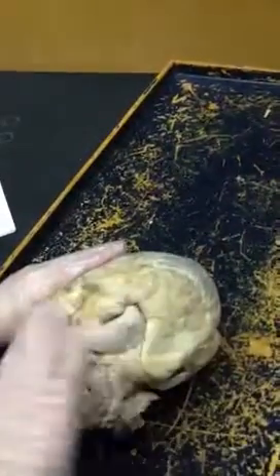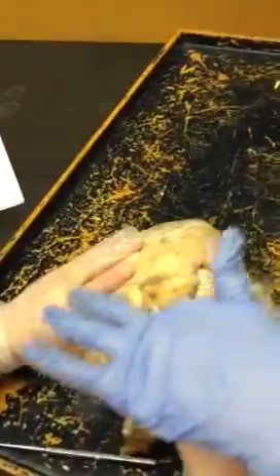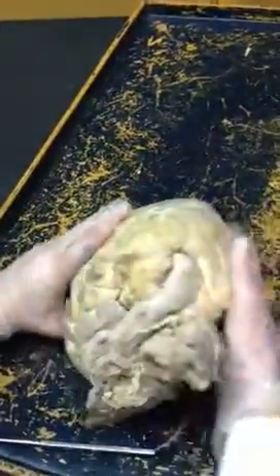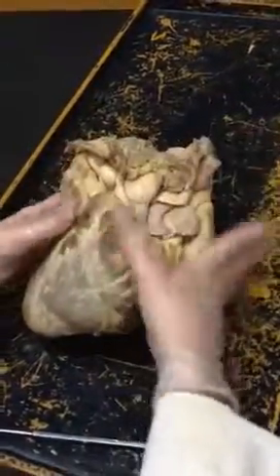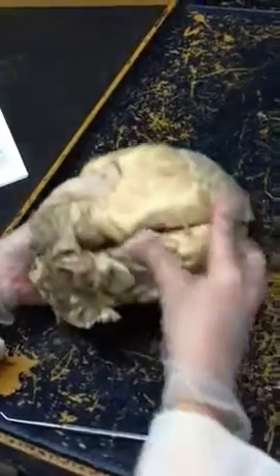So we have the pretty side versus the ugly side — this is the pretty side. With the pulmonary trunk — yes, that's the pulmonary trunk. This side is nice and neat, and this side is very, very ugly and you can't tell what's what. This side is the back, this side is the front. This is the right, this is the left, making that the left atrium and the right atrium.